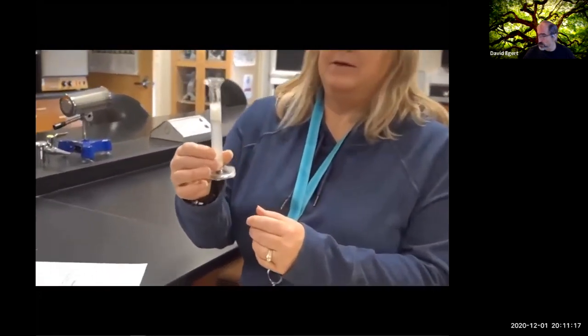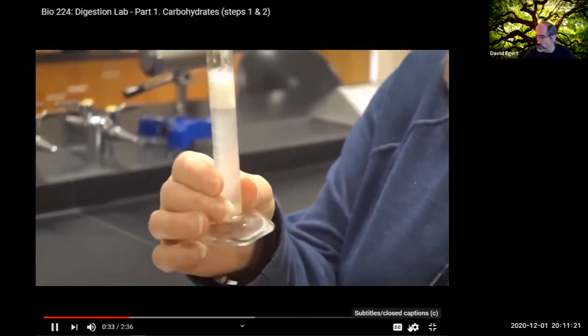So I have close to 8.5, almost 9 mils. And so I've been salivating, collecting it in my little spittoon graduated cylinder. We're going to be using this for not only the spot plate experiment, but also for the 5 tubes of the carbohydrate digestion. So just making it really clear, for this experiment, we really are just using spit. This is not something we bought from a chemical supply house. The results you're gonna see are from Becky's spit, and you'd see the same results if it was your own spit. So this is the quality of your own saliva, besides just being something that looks like spit. It's got some cool chemical stuff going on.